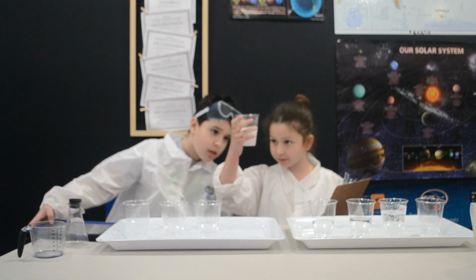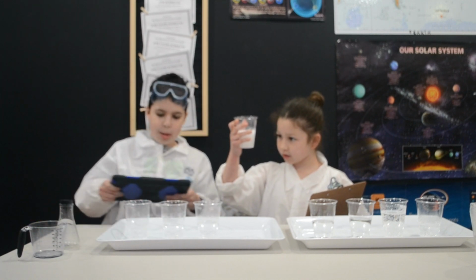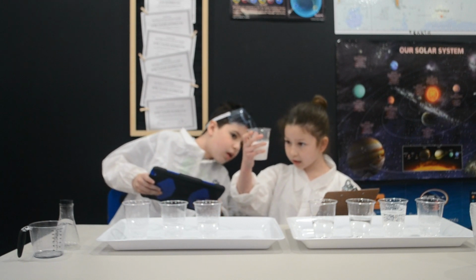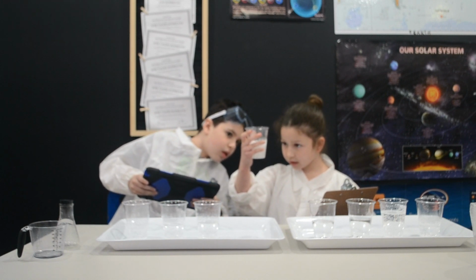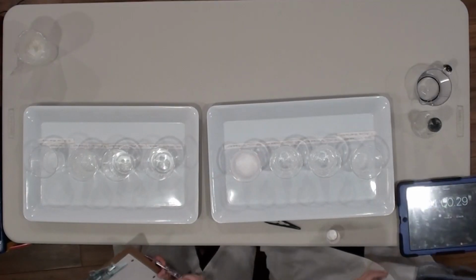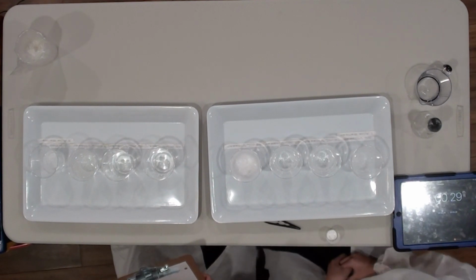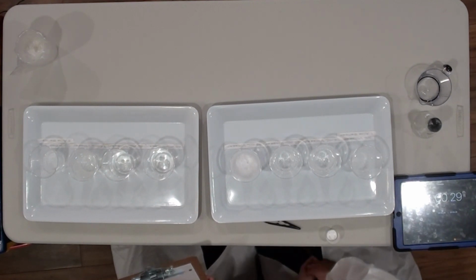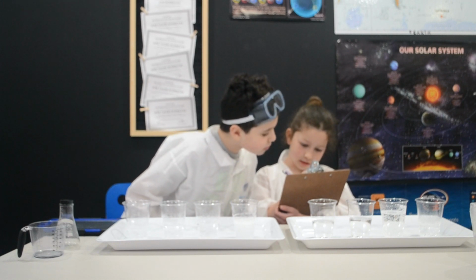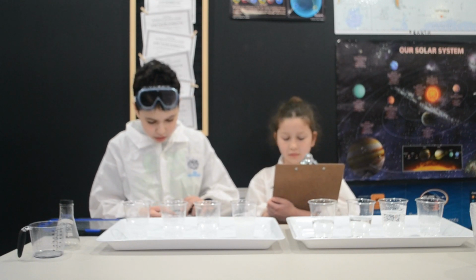Got it. It's almost done. And it's gone. 1 minute, so 60 seconds. 60.29 seconds. Now 40 milliliters of vinegar.